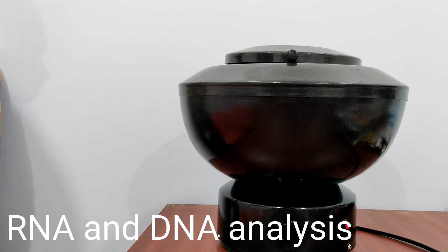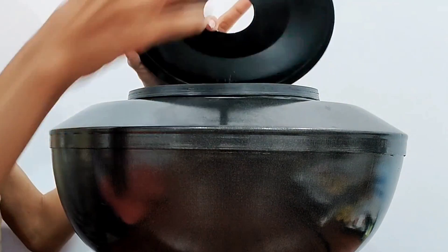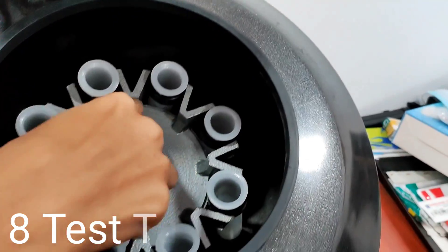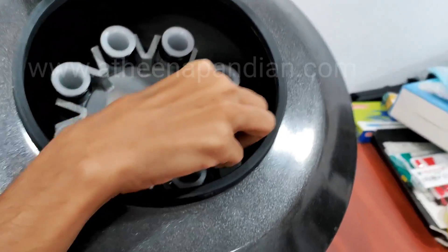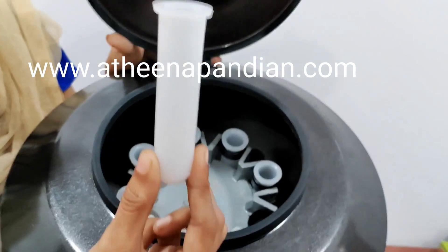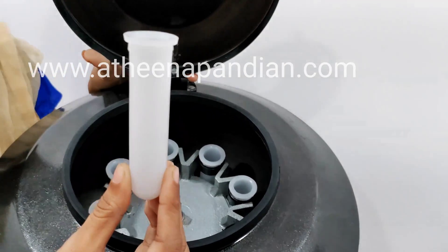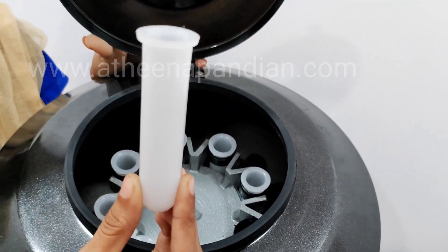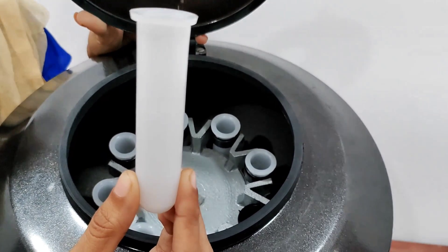Now I am going to demonstrate the parts of the centrifuge device. First, we can see this is the lid or top of the centrifuge. Inside it, you can see the chamber, which has an aluminum rotor with eight test tube holders. This is the test tube holder which is used to hold the vacutainer. The vacutainer is a plastic test tube used to hold samples or any solution, which contains a chemical anticoagulant solution based on the sample analysis.